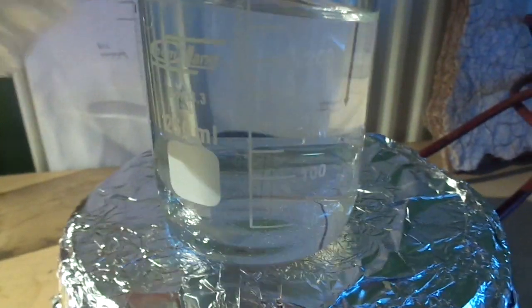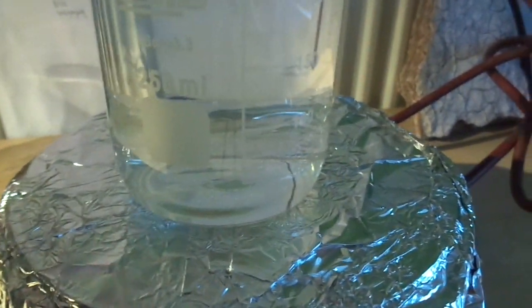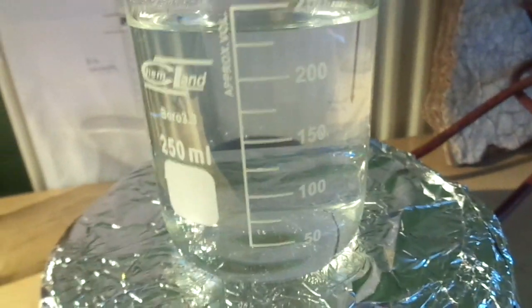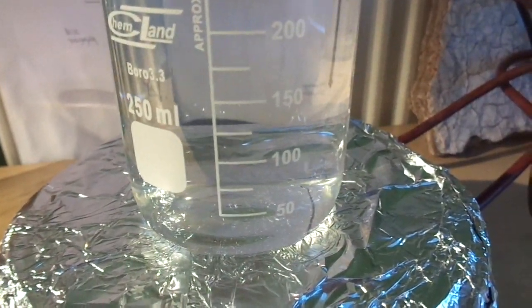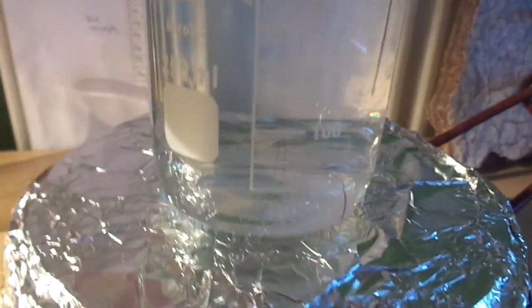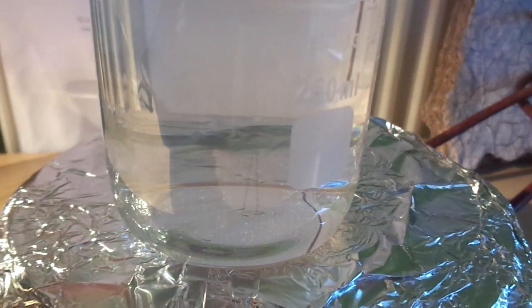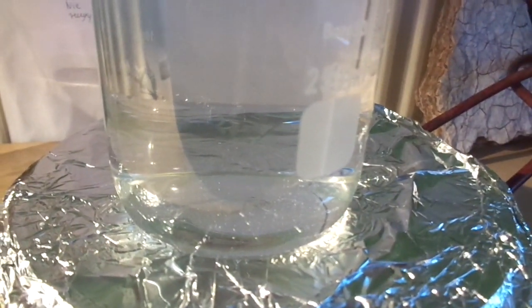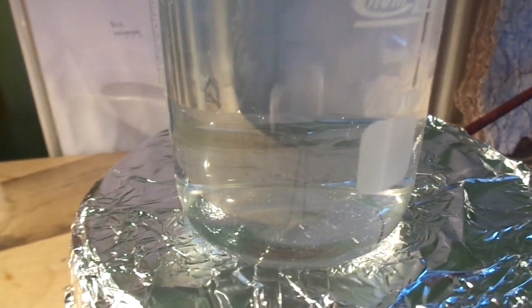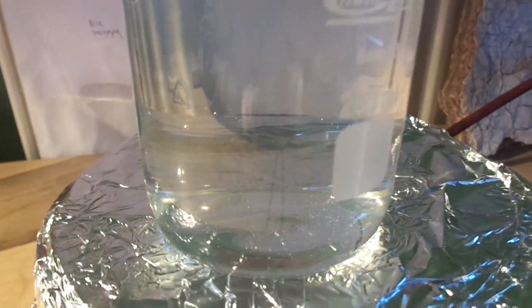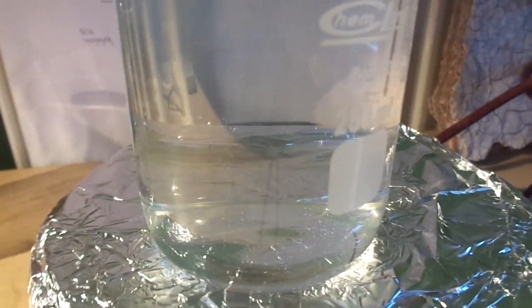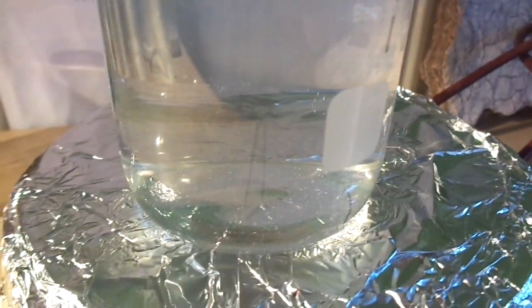Now we're going to boil down the solution, just a little bit, a few hundred milliliters, maybe less. Just boil it down and then you are going to cool this. Because of the boric acid not being super soluble in cold water, it's going to drop out as crystals. Then we are going to decant off the water and dry our boric acid.